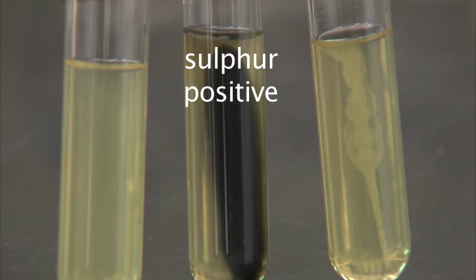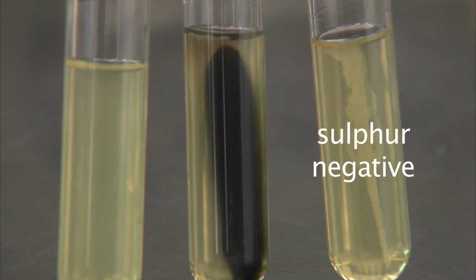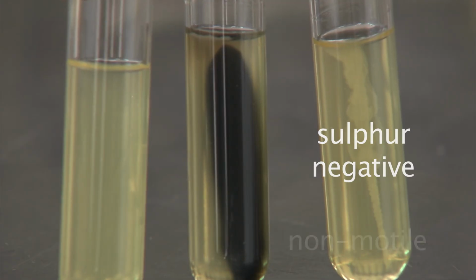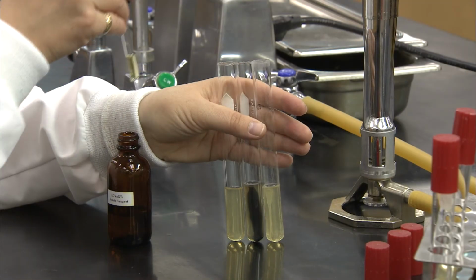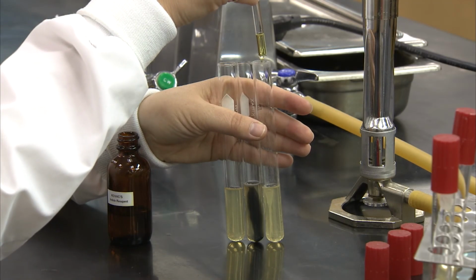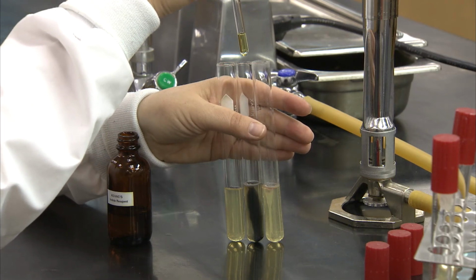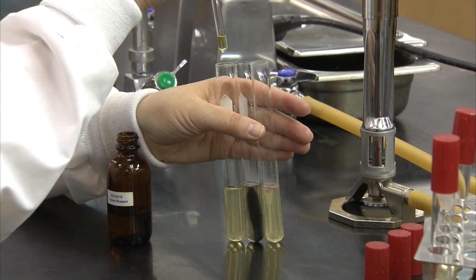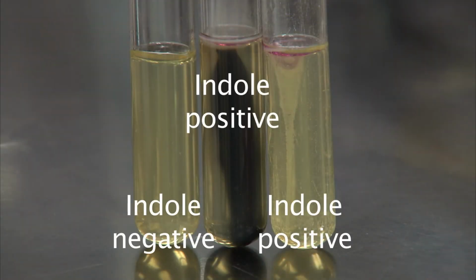You may be able to determine the oxygen requirements for the culture by observing the areas of growth and whether or not the culture is motile by looking for a cloud of growth away from the stab. A few drops of Kovacs reagent is added to the cultured tubes to check for indole production. Within seconds, you should observe the solution turning magenta for a positive result, or remaining colorless for a negative result.